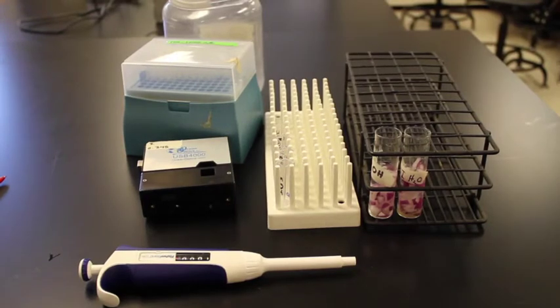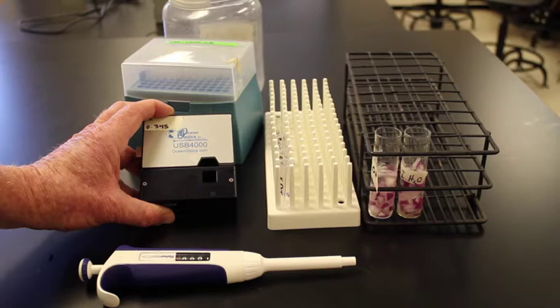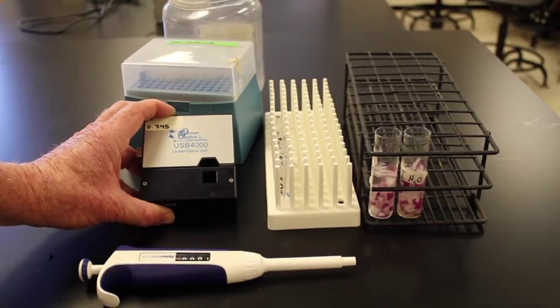The next step is to take each solution and estimate the amount of pigmentation in the solutions. To do this, we'll use a spectrometer. The spectrometer hooks up to the computer and runs on software, and basically is going to be used to measure the amount of light that gets absorbed by the pigment in the solution. So it's basically going to give us an estimate of the amount of pigmentation in the solution.